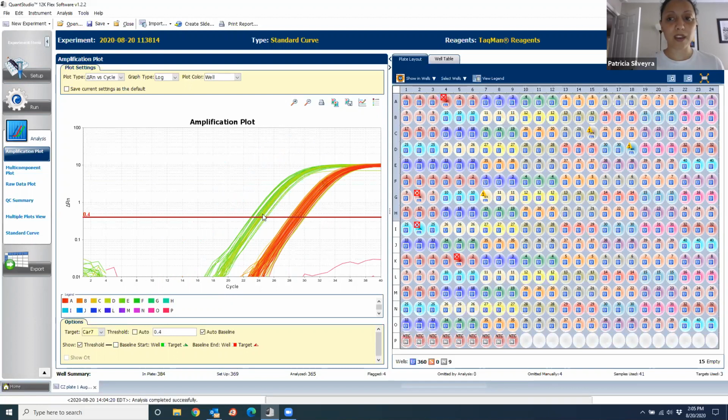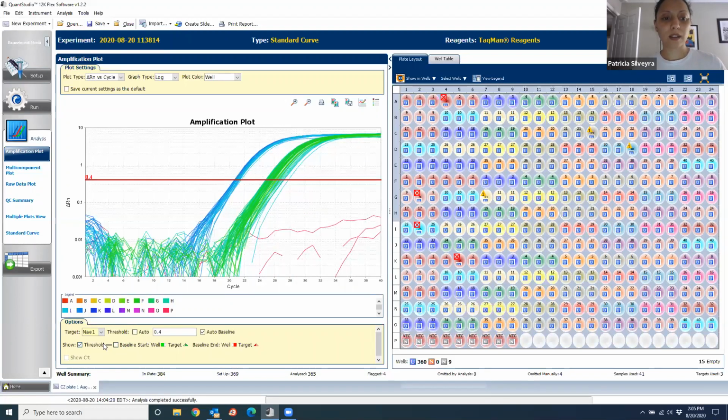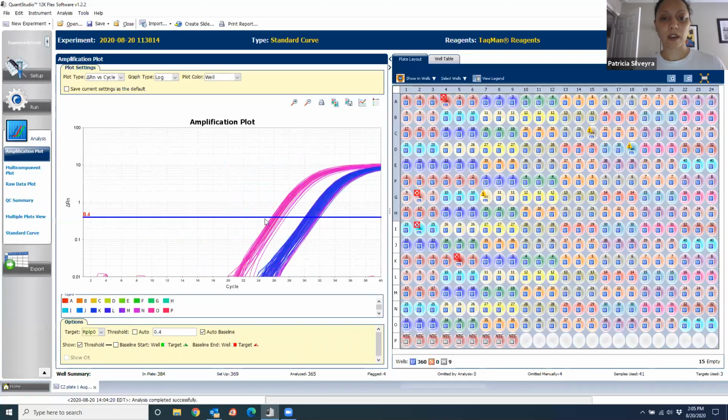So to do the analysis, we are going to need the CT value for the gene, in this case CAR7, or Nae1, and the CT value of the housekeeping gene, because we're going to use a formula that incorporates all those values and does a mathematical calculation for the gene expression.